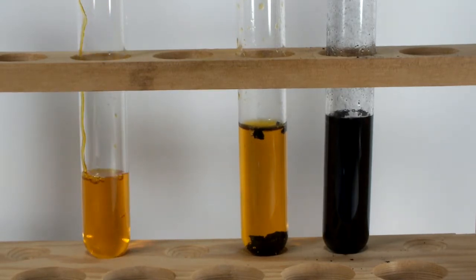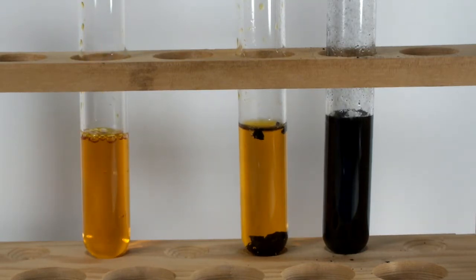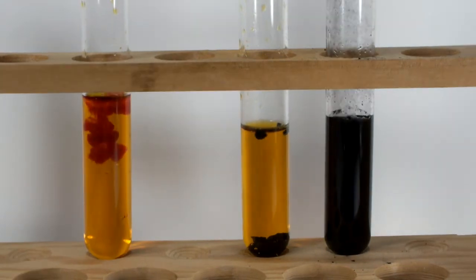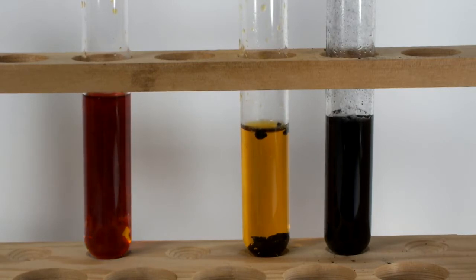In another paper I found, they made use of a chemical called chloramine T to oxidize the dye and thereby decolorize it. I don't have any of that, so I'm just going to test what happens when I add an insanely strong oxidizer. Normally, I would have gone to 35% hydrogen peroxide, but after I did that ferroin video, I'm opting for nitric acid instead.